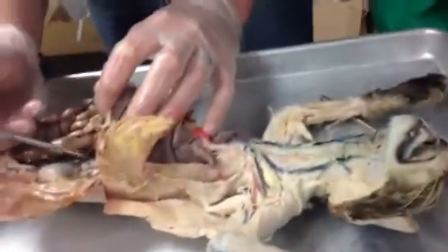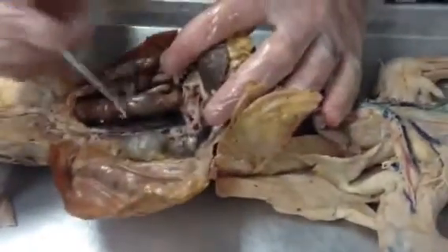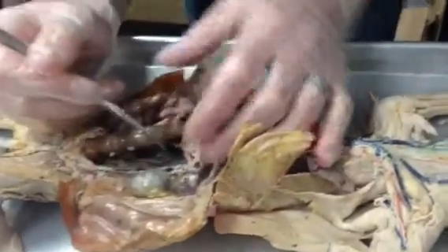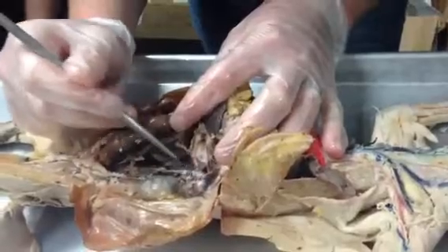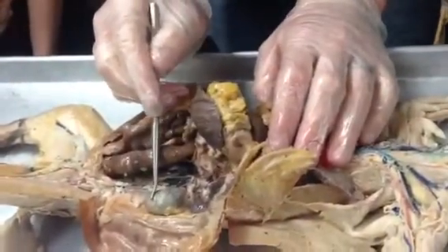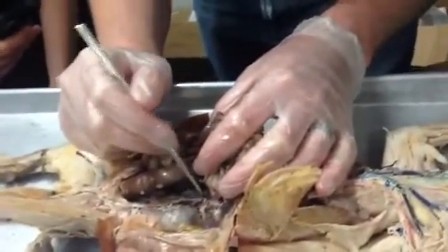Okay. So then the next large artery that you can see down here is the superior mesenteric artery. And if we dig a little bit onto the dorsal wall, we'll start to see veins and arteries that you should be able to pick apart pretty easily. So you guys all know what this structure is, right? Kidney. Kidney, right. And so there's the renal artery and renal vein.